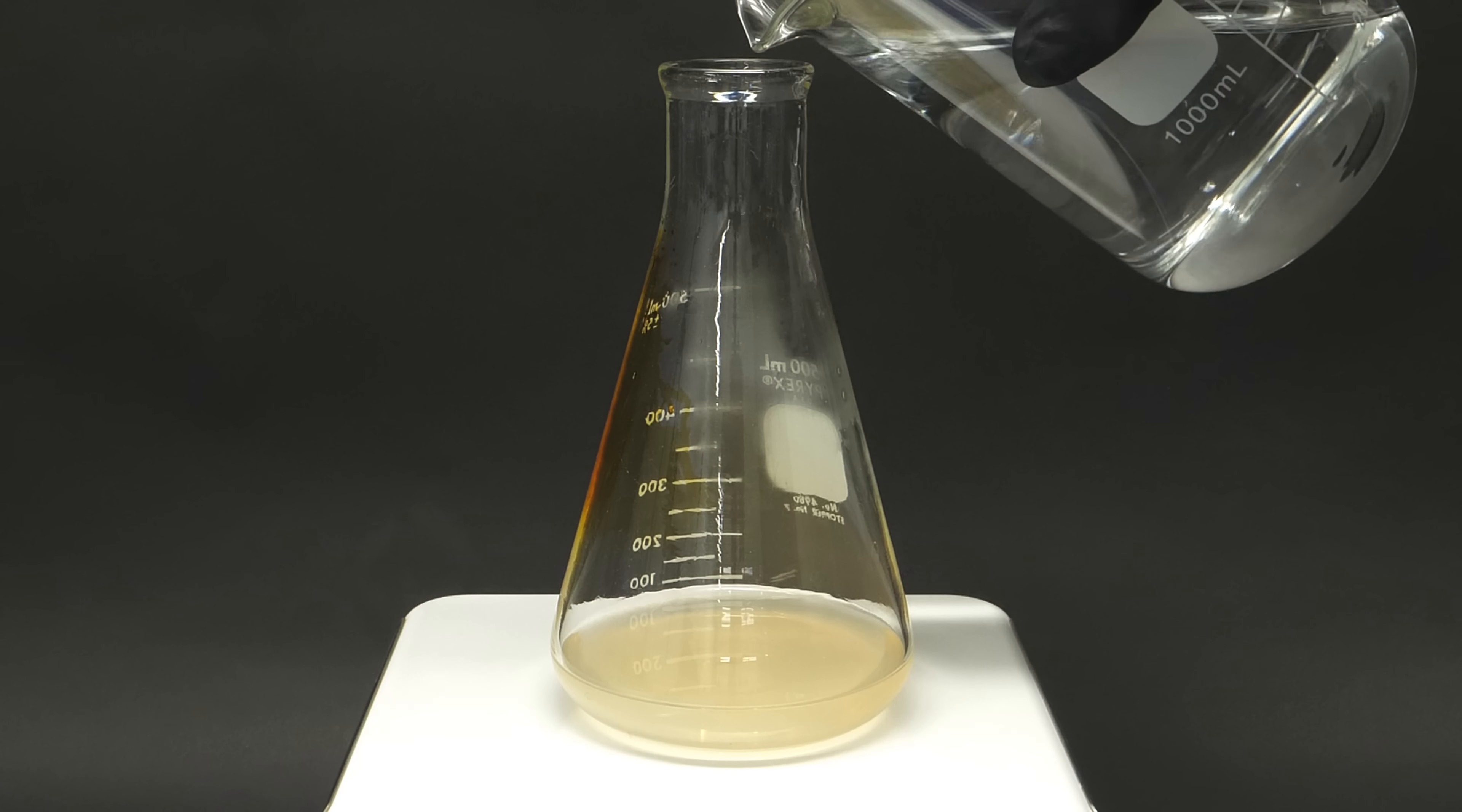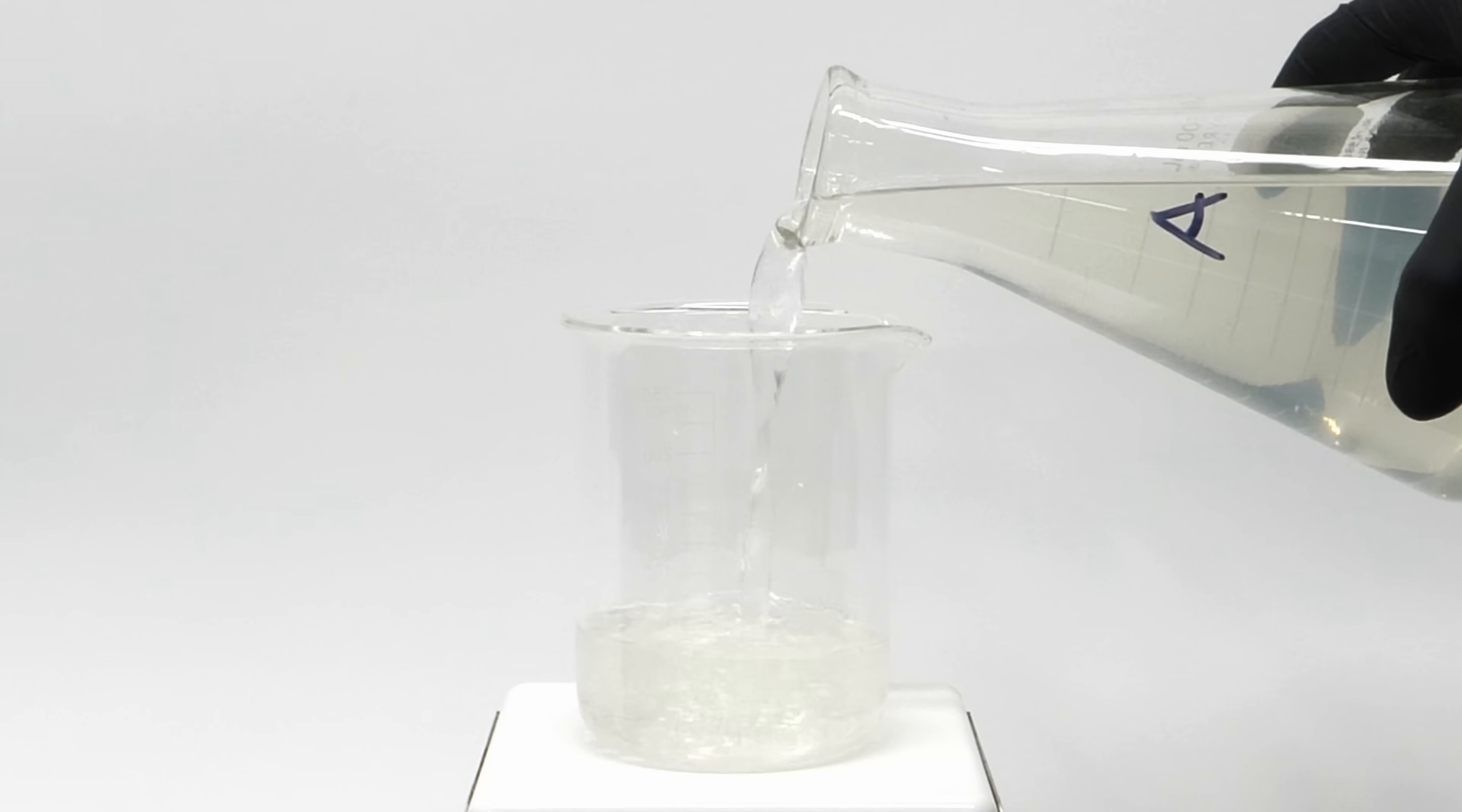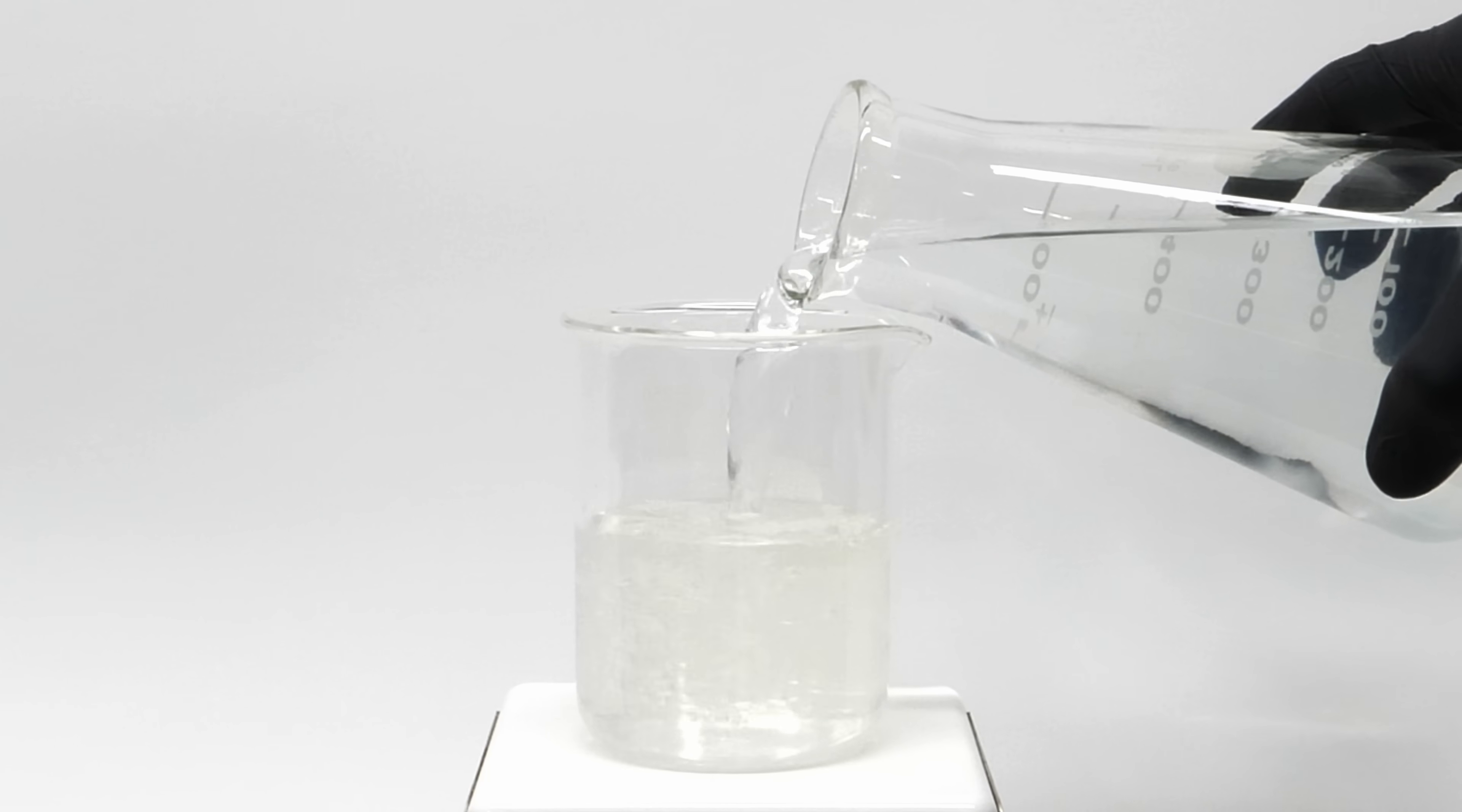On top of this, I'll add a bunch of water, and that's it for part A. Now, all I need to do is mix together these two solutions.